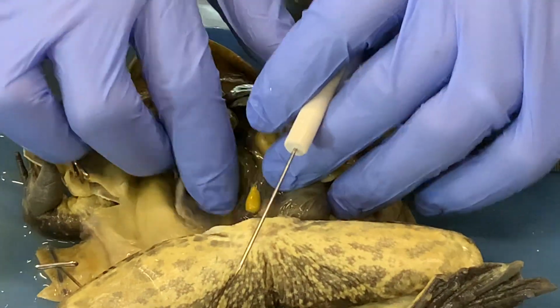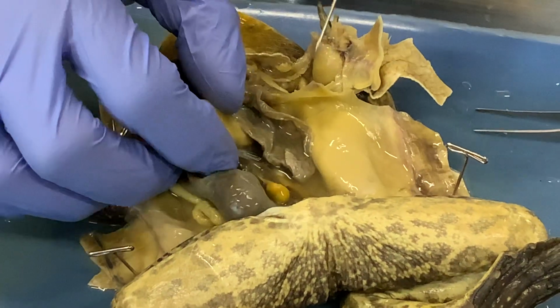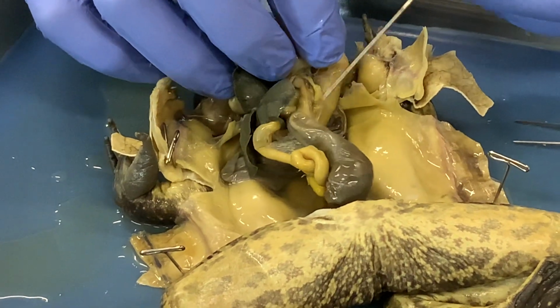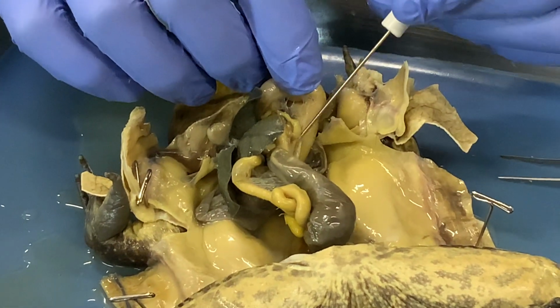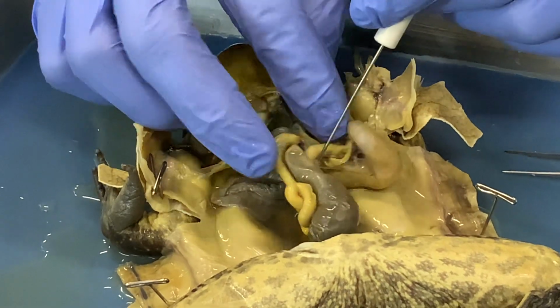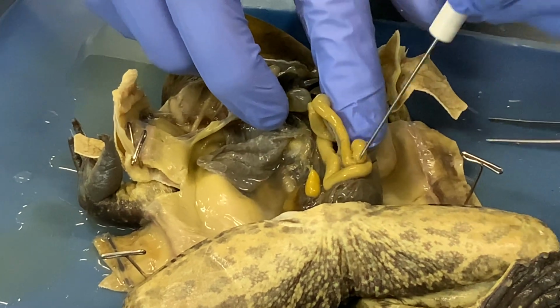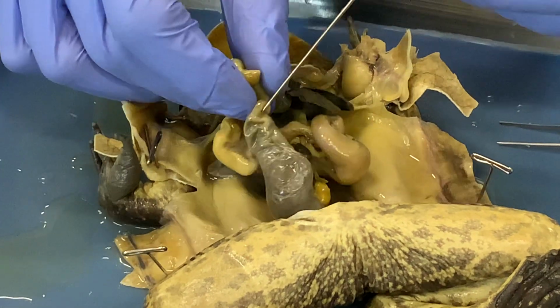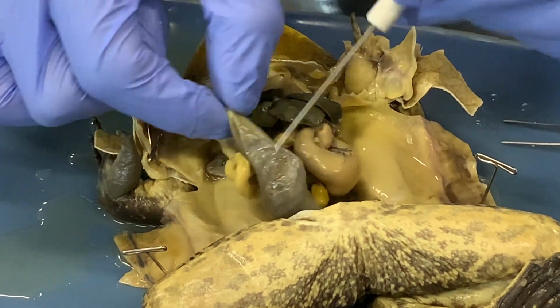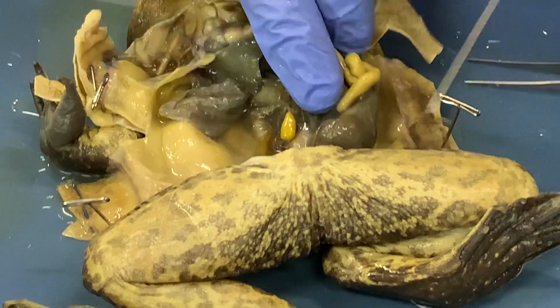That is connected to the pancreas, which in this frog is very small. Some frogs have a very large pancreas, but it is just that yellow tissue coming off of the tube right here. That is its pancreas. If we follow the digestive tract back, we have small intestines here that loop around and are convoluted back and forth through the abdomen here, connecting to the large intestine, or colon, which is this structure here. And then the digestive tract leaves through the pelvis and out the anus here.